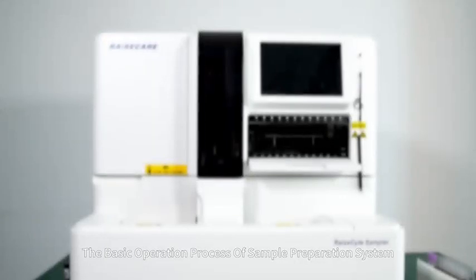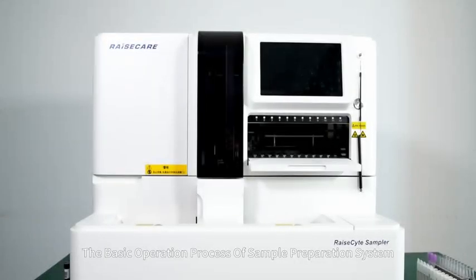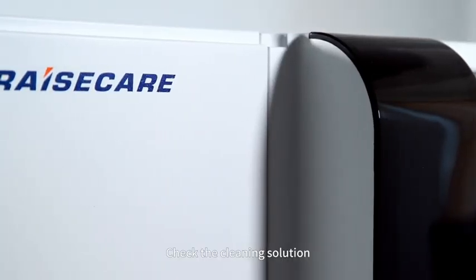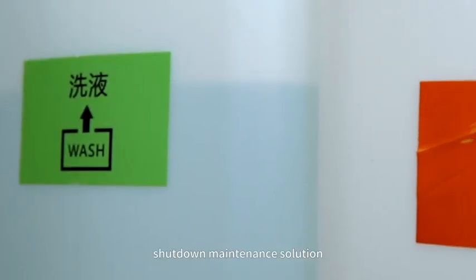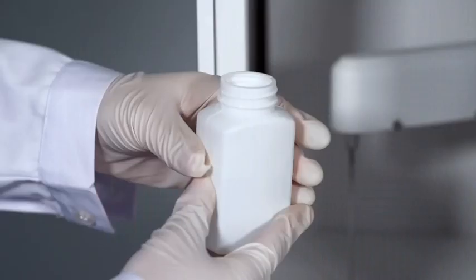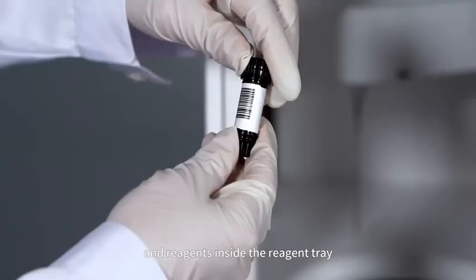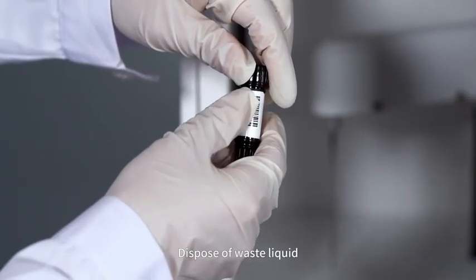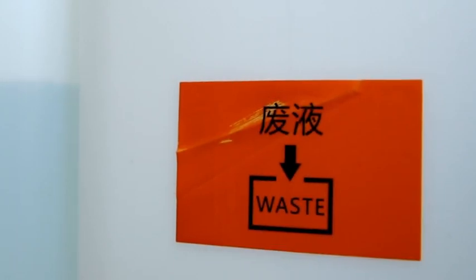The basic operation process of the sample preparation system. 1. Before starting up, check the cleaning solution, shutdown maintenance solution, washing buffer solution, lysing solution, and the reagents inside the reagent tray to ensure all have sufficient volume. Dispose of waste liquid.